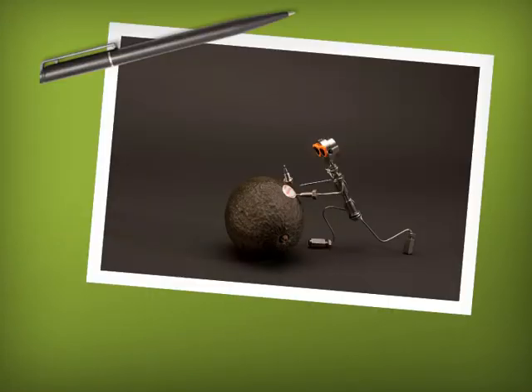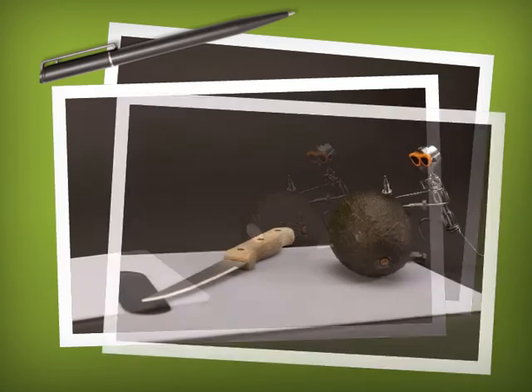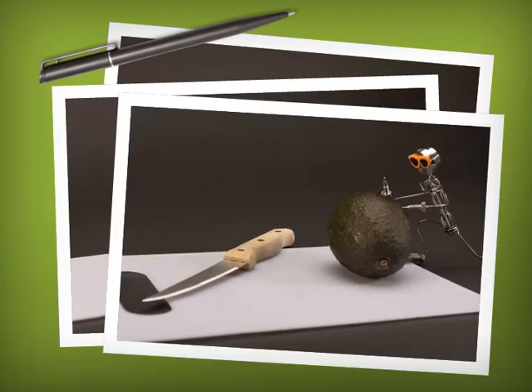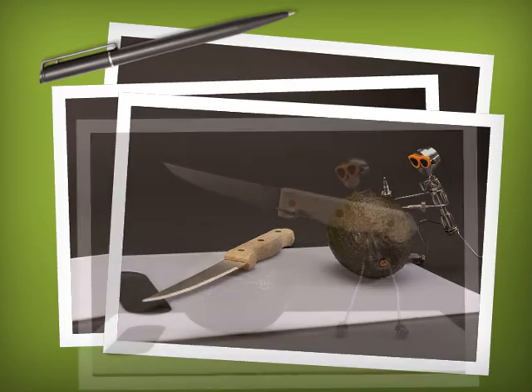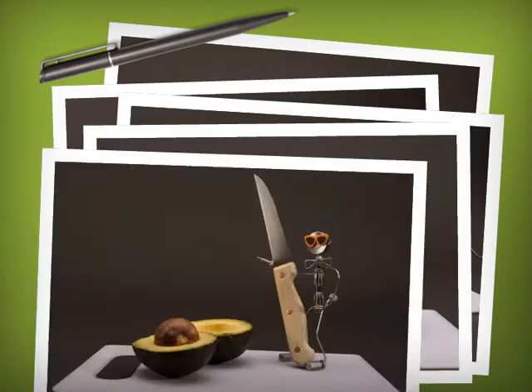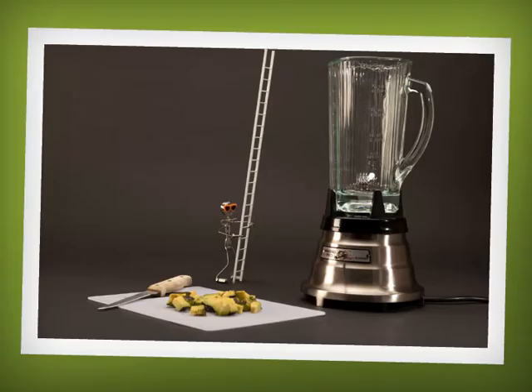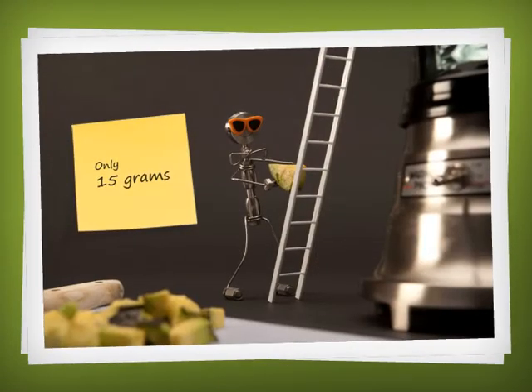By using the entire fruit or vegetable, you're able to obtain a more representative sample. The QuEChERS procedure can also be used to extract pesticides from prepared juices. Here we have a whole fruit — chop your sample into small pieces. You don't need the pit.